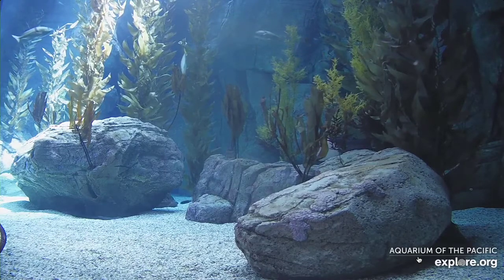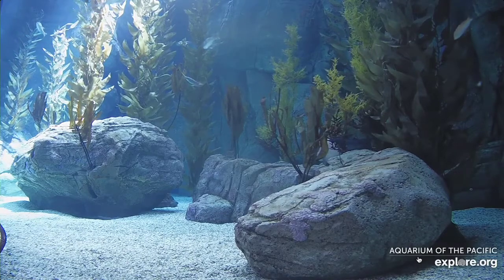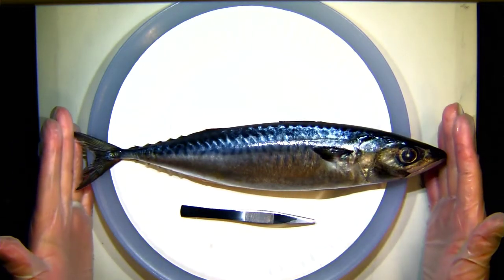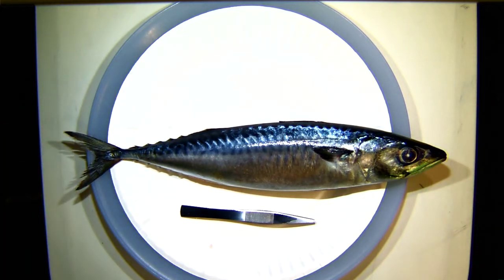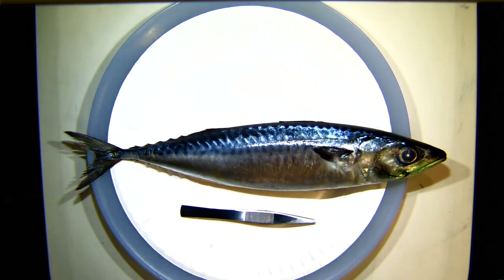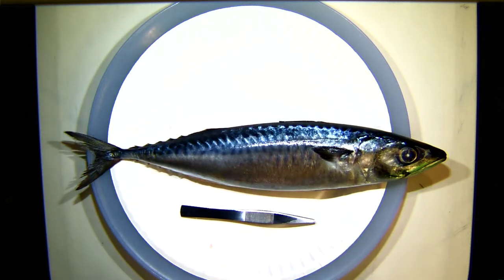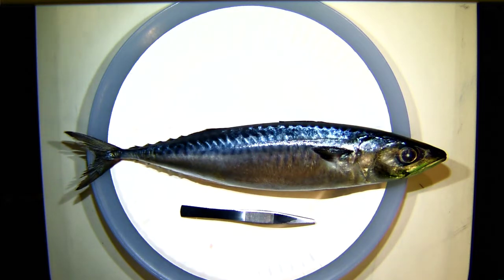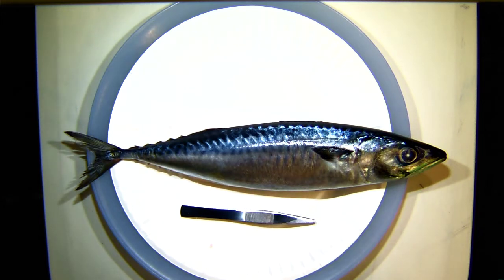So this is a mackerel dissection — we are going to be looking at a Pacific mackerel. The Pacific mackerel is a pretty cool fish. This one right here is probably just over a foot long. They can get to be about twice this size when full grown. So this one is kind of a juvenile — it's still developing. Again, this was going to be food for our animal friends here at the aquarium, but instead we're using it for our exploration.